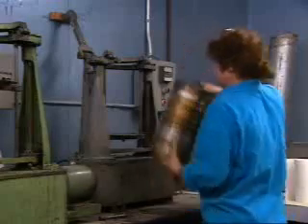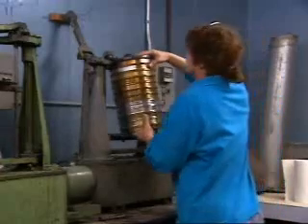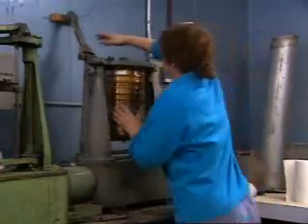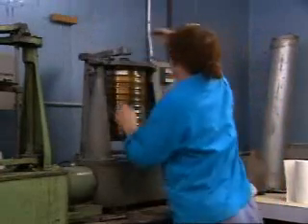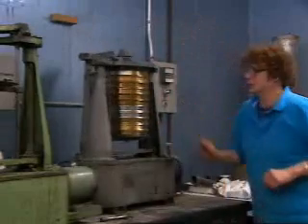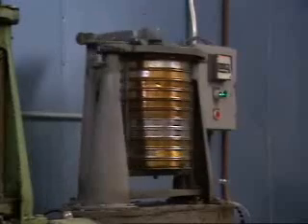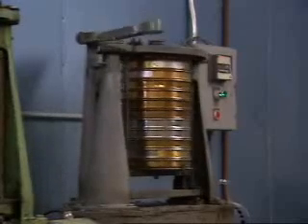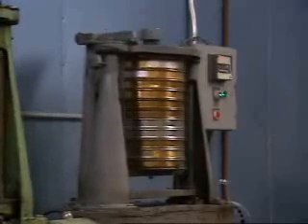A known quantity of ore is put on the top screen, and the entire stack is then put on the ro-tap machine. This machine shakes and taps the screens for about 20 minutes. During this process, the fine particles fall through most of the screens and accumulate on the bottom screens, while the coarser particles stay toward the top.